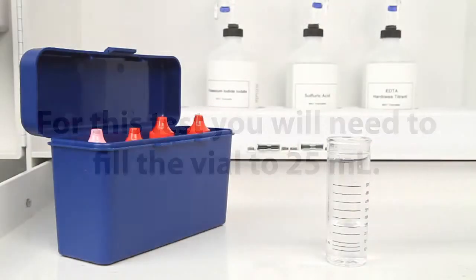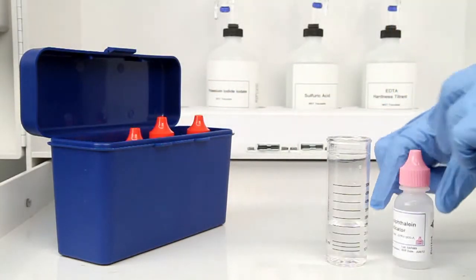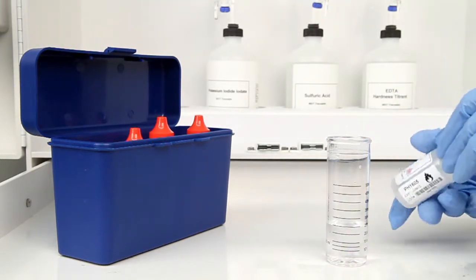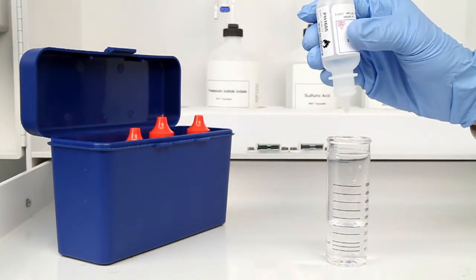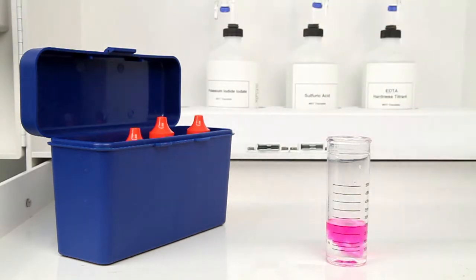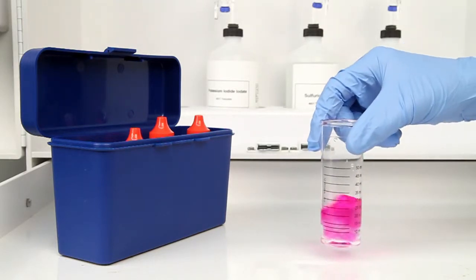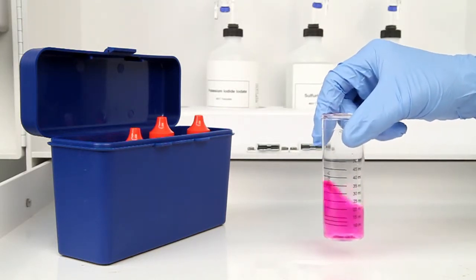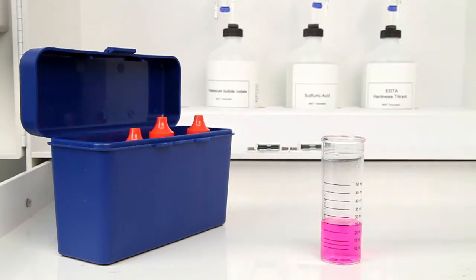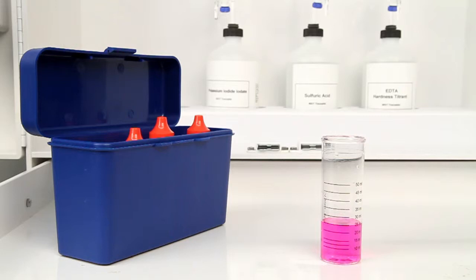The next step according to the Endpoint ID procedure is to add three drops of phenolphthalein indicator. The bottle contains a dropper tip, so it's important to hold the bottle vertically to get a consistent drop size. After the addition of each reagent, it's important to swirl the vial to make sure the reagents are properly mixed. In this example, the sample is turned pink, indicating that there is P alkalinity that needs to be titrated.